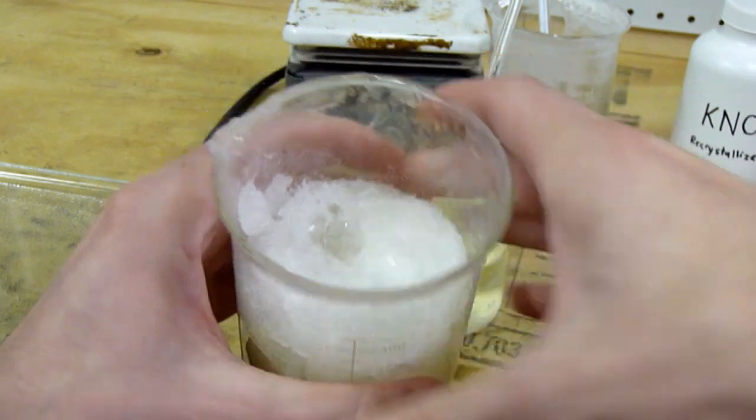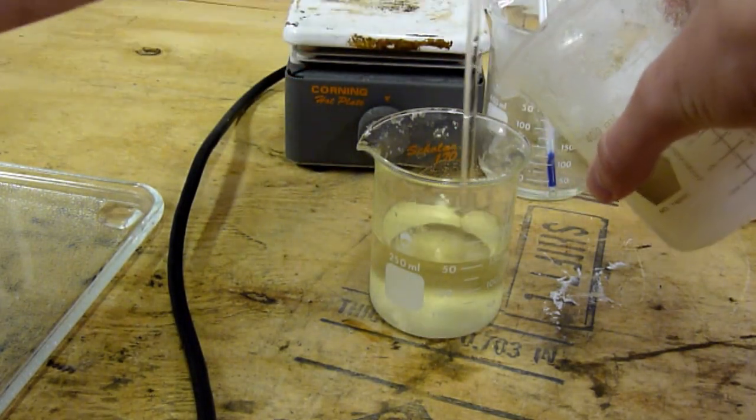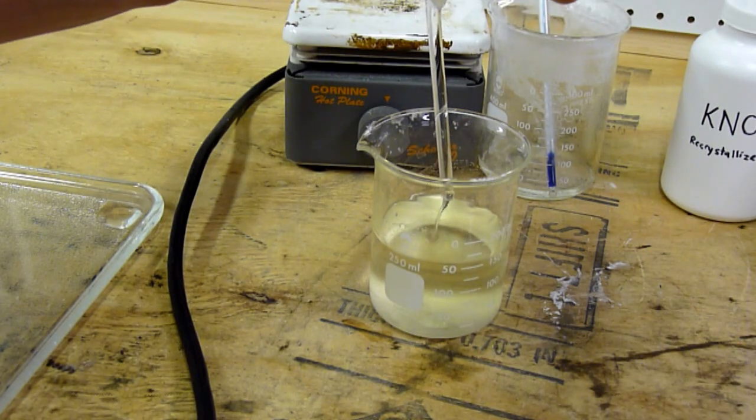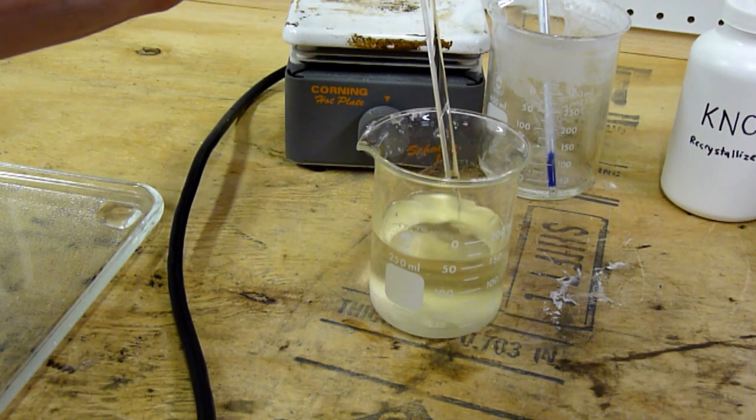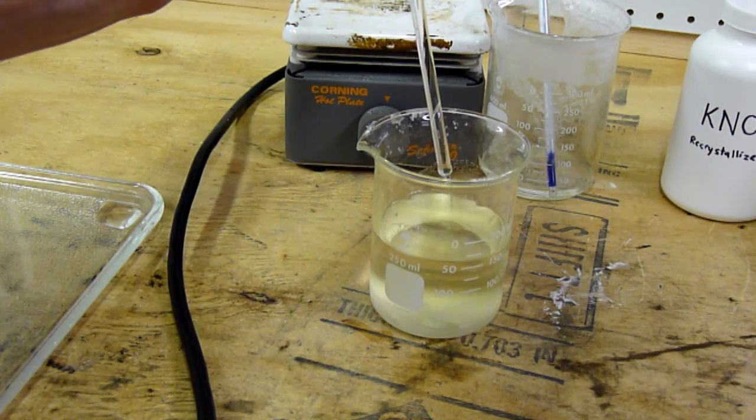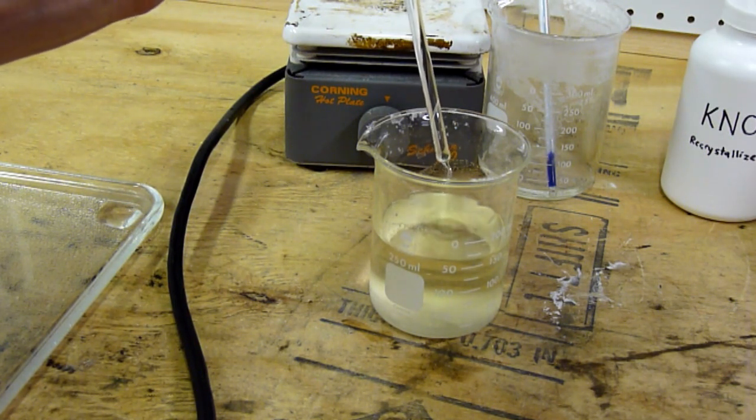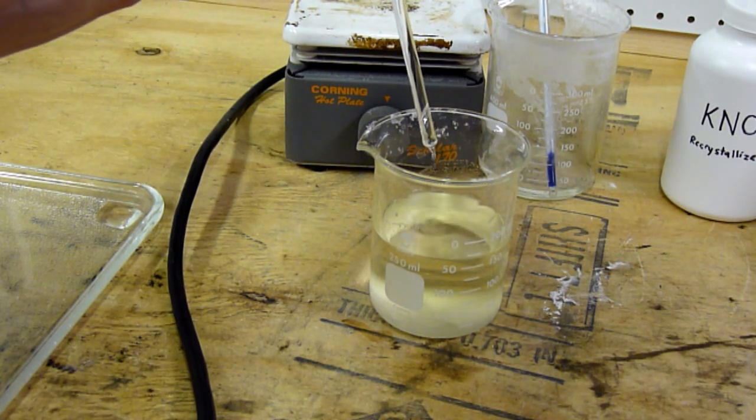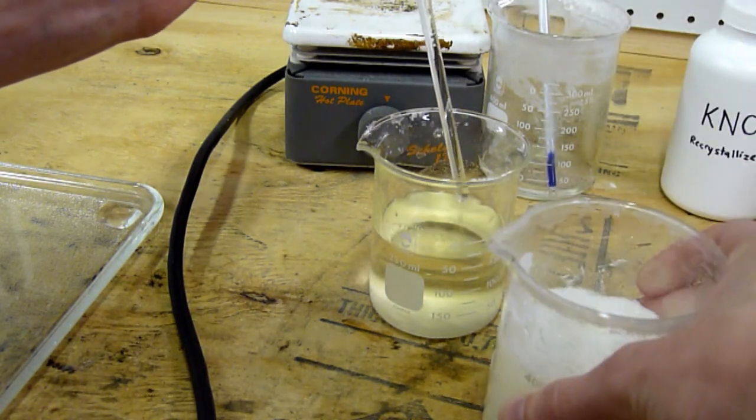Let's see if I can decant anything further. As you can see, I'm definitely getting more out. These crystals are nice too. The ones on top look really long. They're really long and needle-like, very fine crystals. It's perfect, that's exactly what I'm looking for.